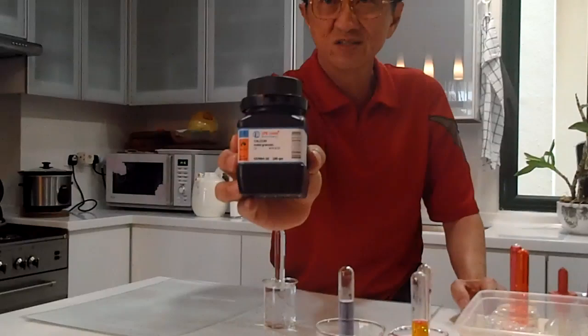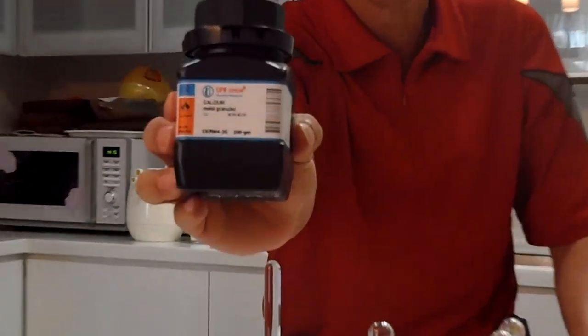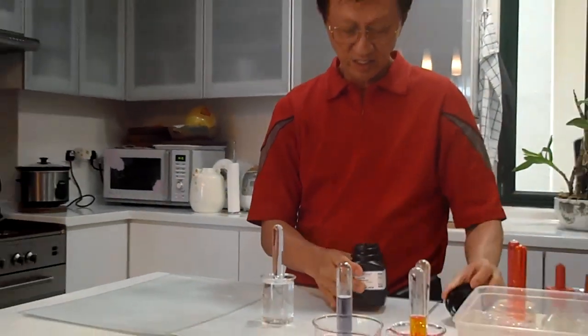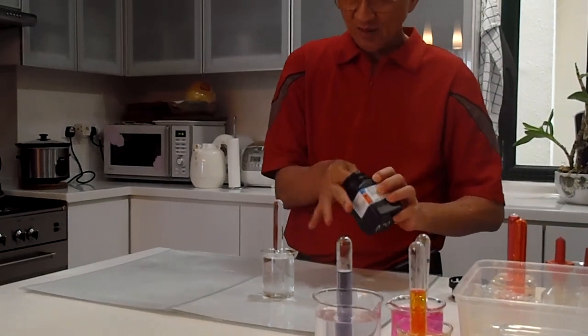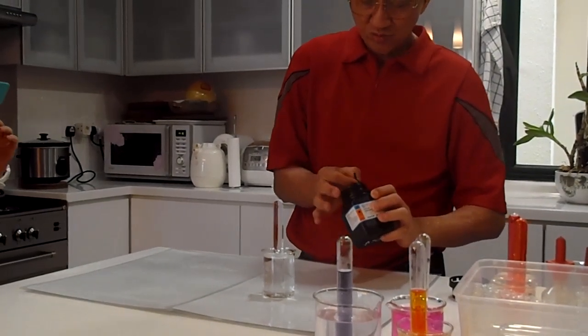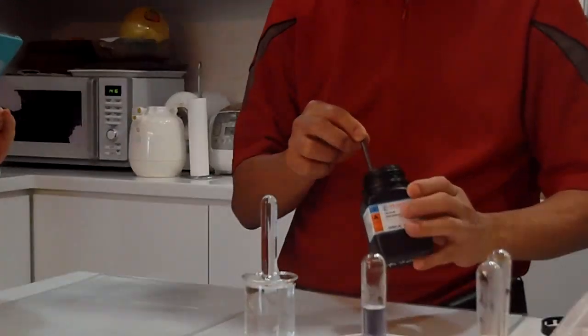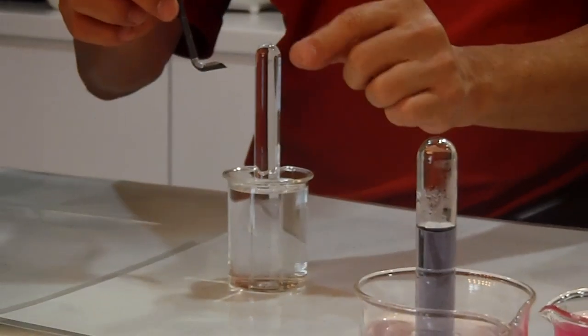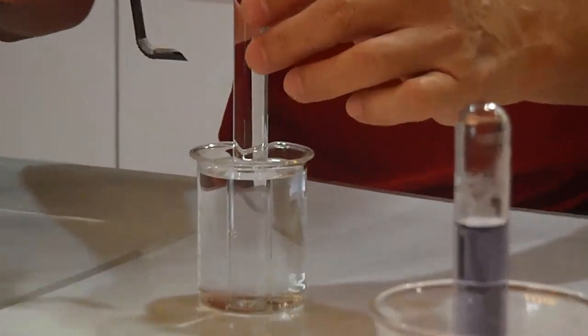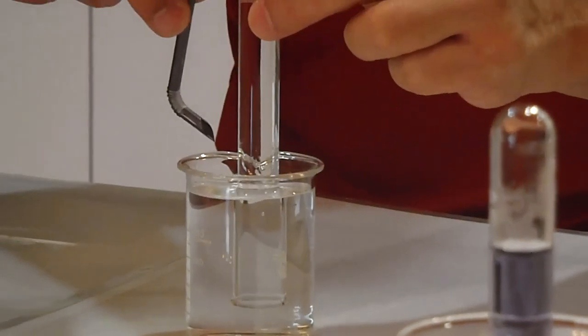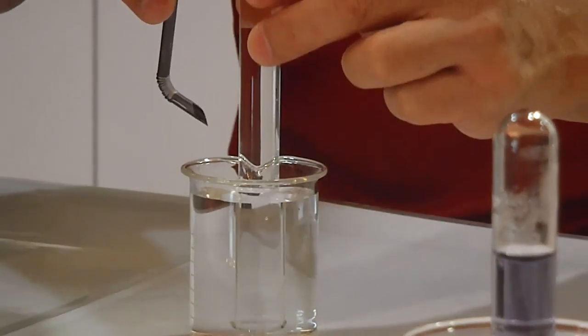Can you zoom in? Calcium granules. Can you see? The calcium granules, I want you to be very observant. I am going to put one or two calcium granules inside and it will initially sink. This test tube is filled with water and you will find that this will sink. You can zoom in. And I am going to collect the gas that comes out.